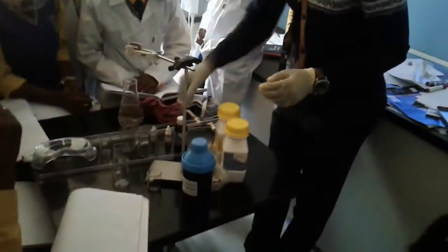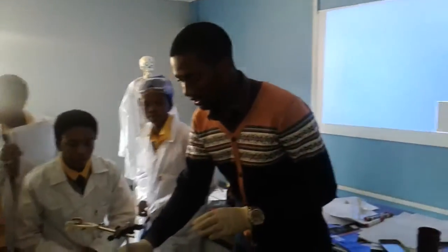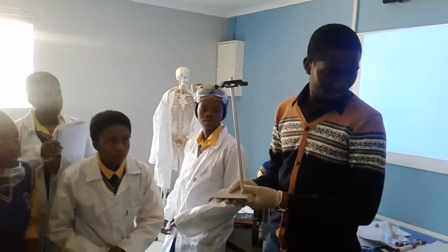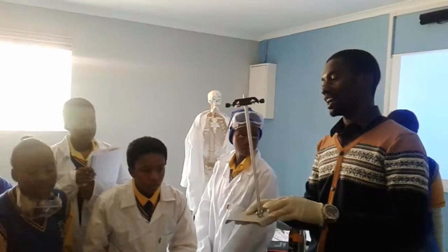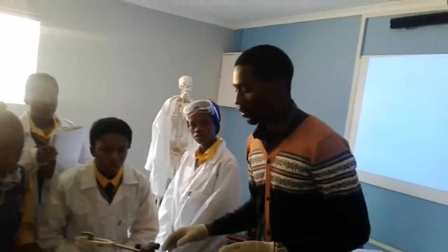Titration. Now, very important words you need to know. What is this called? What stand? Retort stand. I'll give you the words. And then what do you call this one?